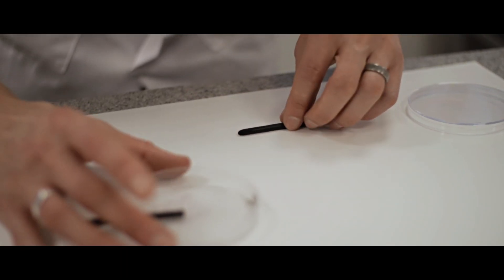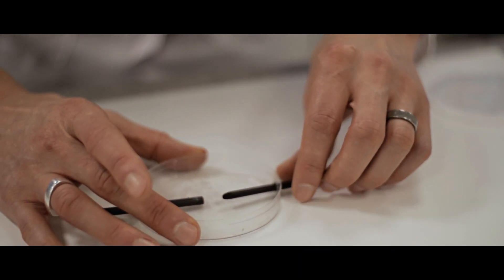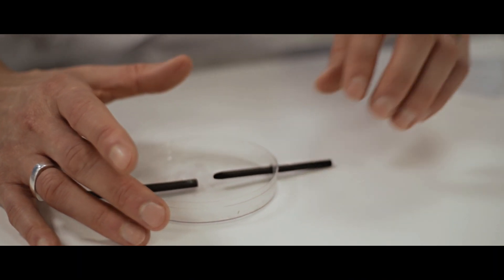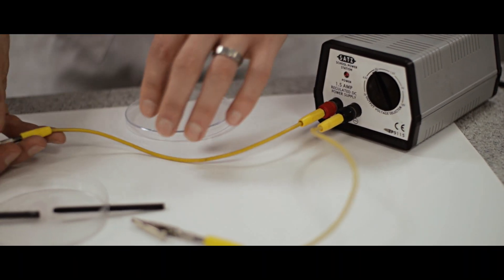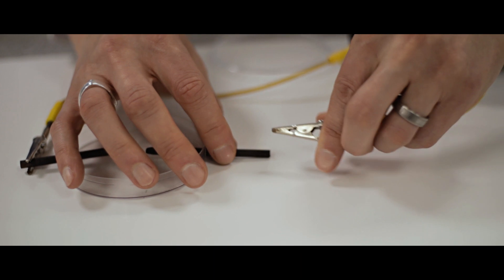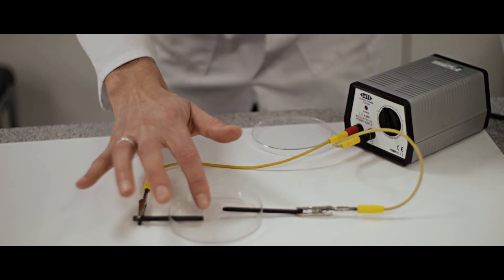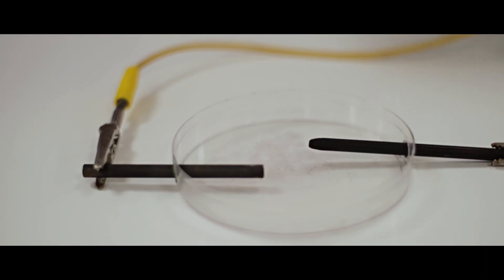We need to set up the petri dish with our electrodes - we've got holes either side and we need a small gap between the electrodes. We've got a flow of electricity through the wires and electrodes, and that flow is caused by the flow of electrons through the wires and electrodes. To complete the circuit we need the electrolyte to sit in between the two electrodes, and that is going to conduct because of the ions that are in the solution.